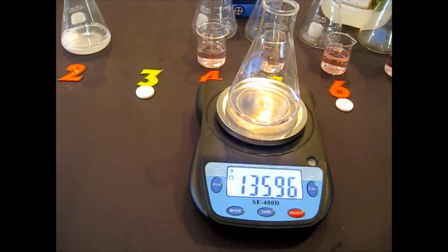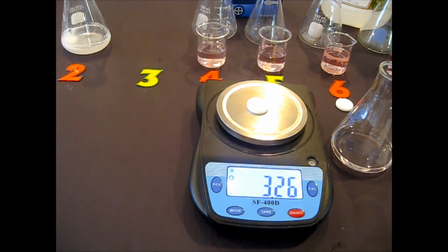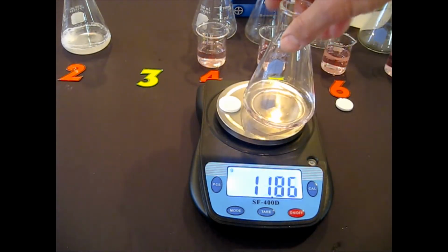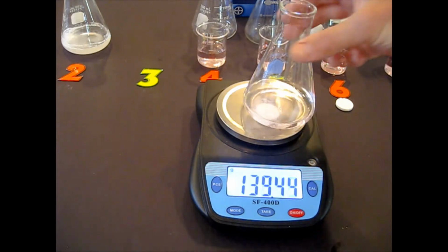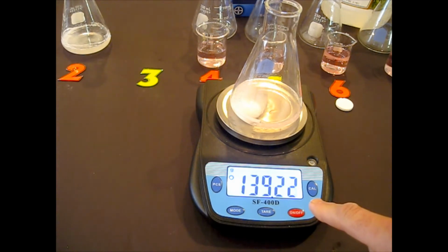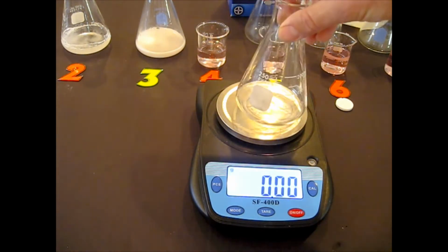This is experiment 3 again. Okay, the tablet I'm going to use in experiment 3 is this one. Right there, the mass of the tablet, column B. Then let's get the mass of everything together, column C. Then I'm just going to plop it in, and the reaction will start. Of course, that should be dropping, just like all of them should be dropping. Okay, so let this reaction go. That's experiment 3. Experiment 4, you know the drill now.